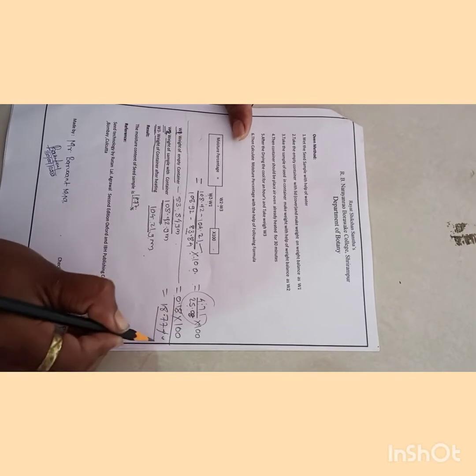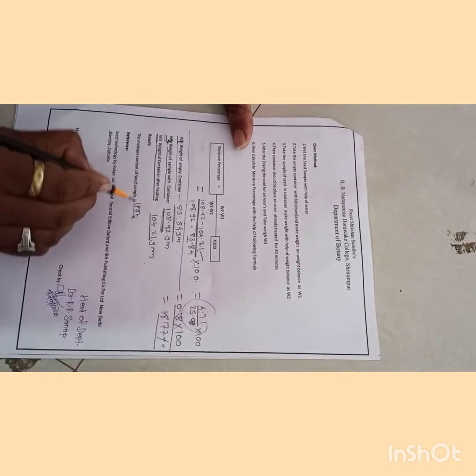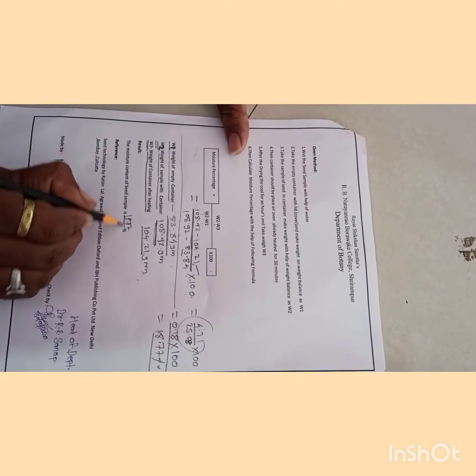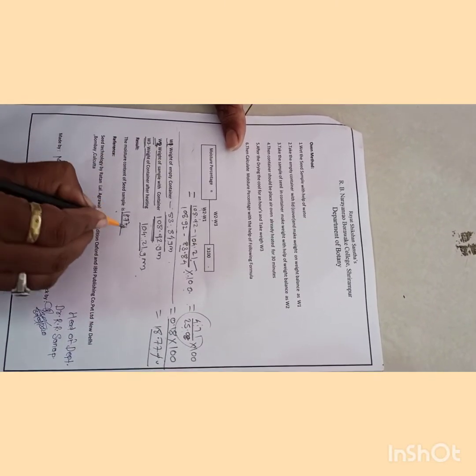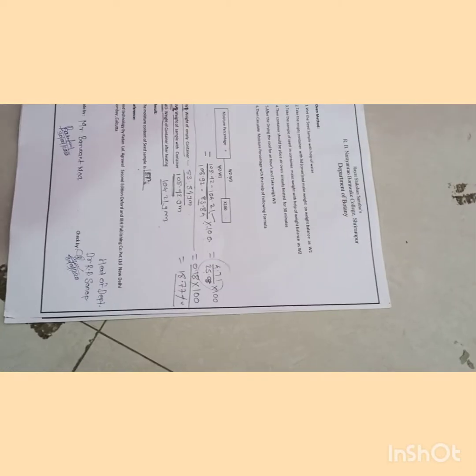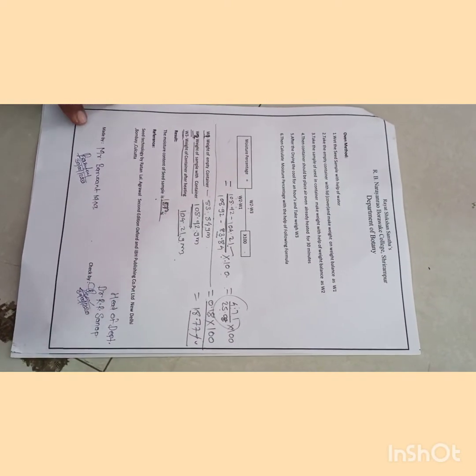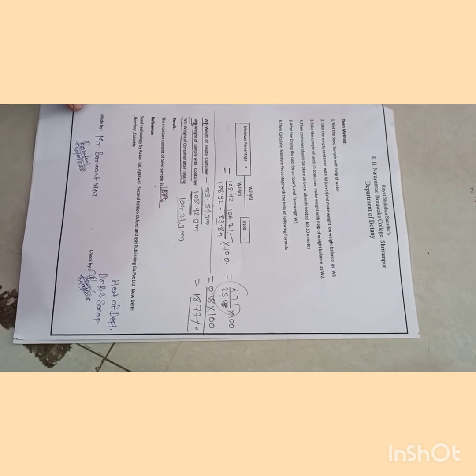The result of our experiment: the moisture present in a pea seed is approximately 18.77%. This is our practical. The reference is taken from the book Seed Technology by Ratanlal Agrawal, second edition, Oxford and IBH Publishing Co. Private Limited, New Delhi, Bombay and Kolkata. Thank you.